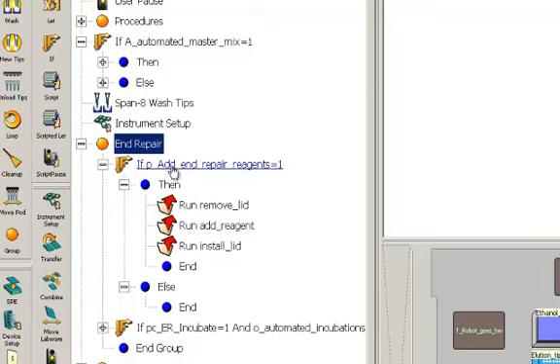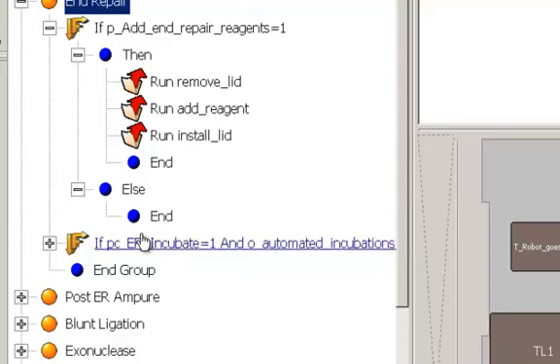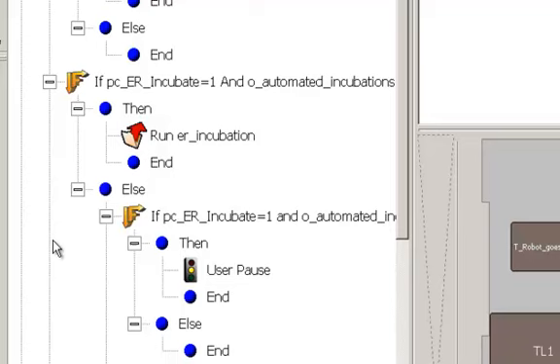If add end repair reagents is set to a 1, in other words, yes, add end repair reagents, it's going to remove the lid from the sample plate, add the reagents, and reinstall the lid. If it was set to a 0, it would take the else branch and not do anything. After that, it looks at if the end repair incubation needs to take place. And if it is set to a 1, if you have automated incubation, it will take the plate and put it in the thermocycler and bring it back. If you don't have automated, it's basically going to pop open a window that tells you to take the plate to a thermocycler.